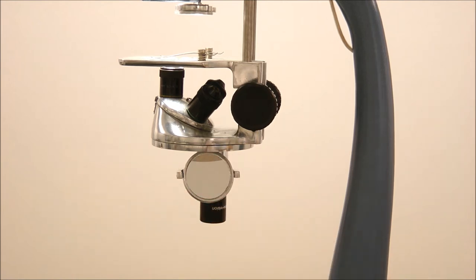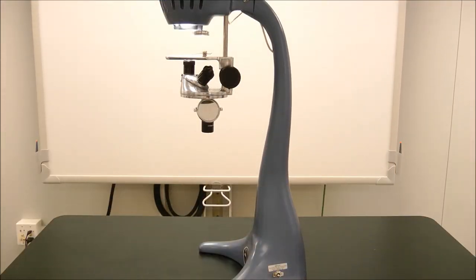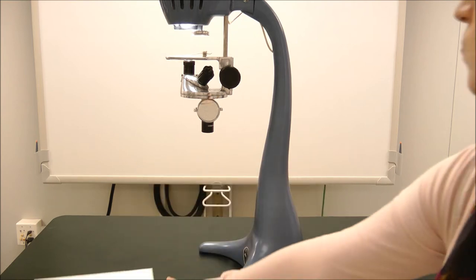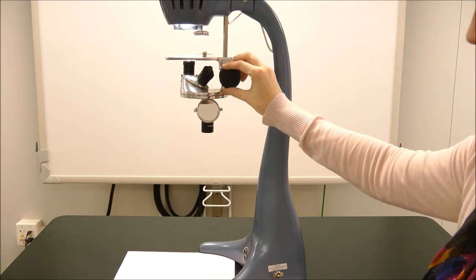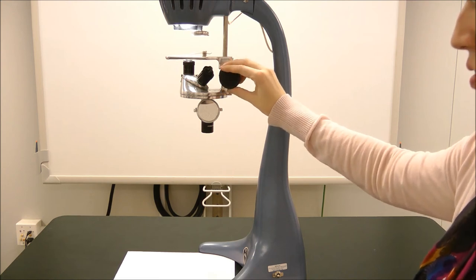For table projection, be sure to place a white sheet of paper between the legs of the base. Make sure the mirror is out of the way of the light beam coming straight through the stage and going to the table surface.